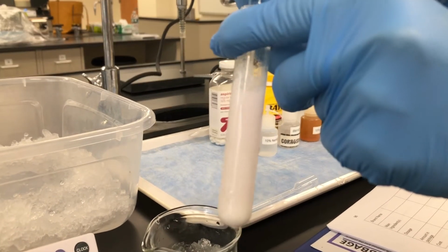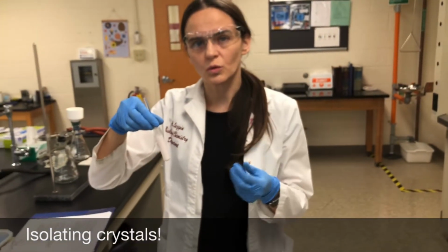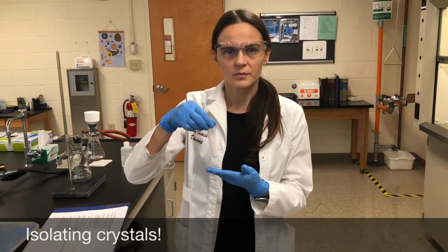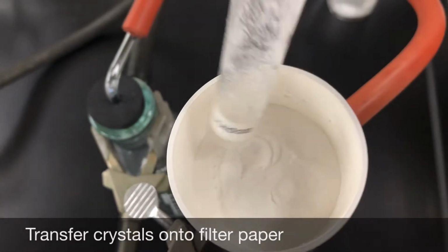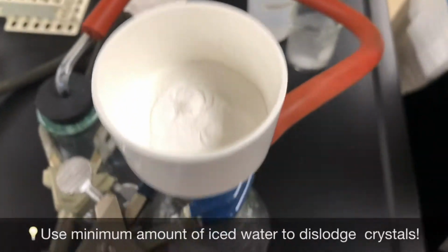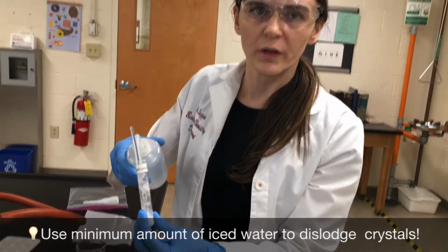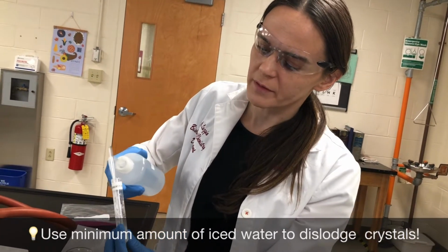Crystals inside the test tube. So my last step will be to isolate the crystals by vacuum filtration. Alright, then you want to use a minimum amount of ice cold water because aspirin is partially soluble in room temperature water but not ice cold water.